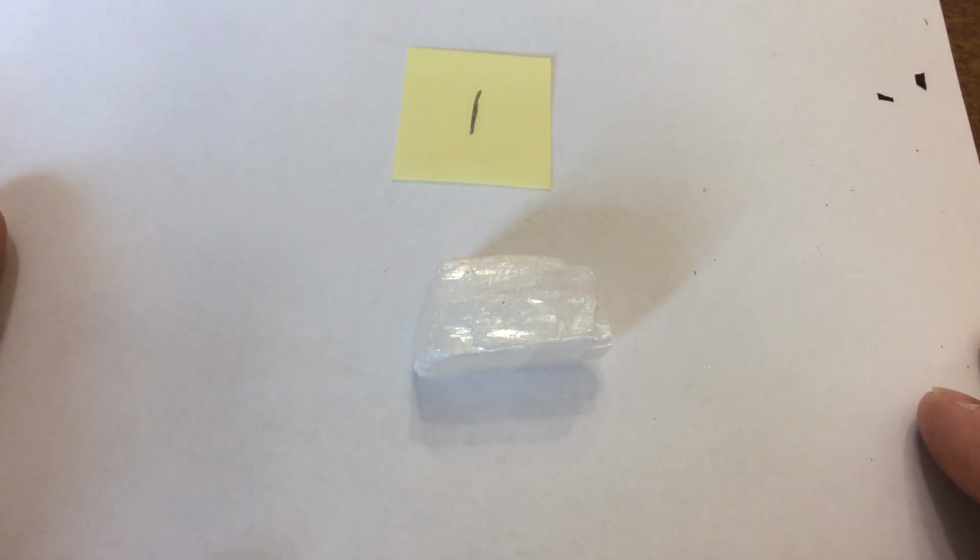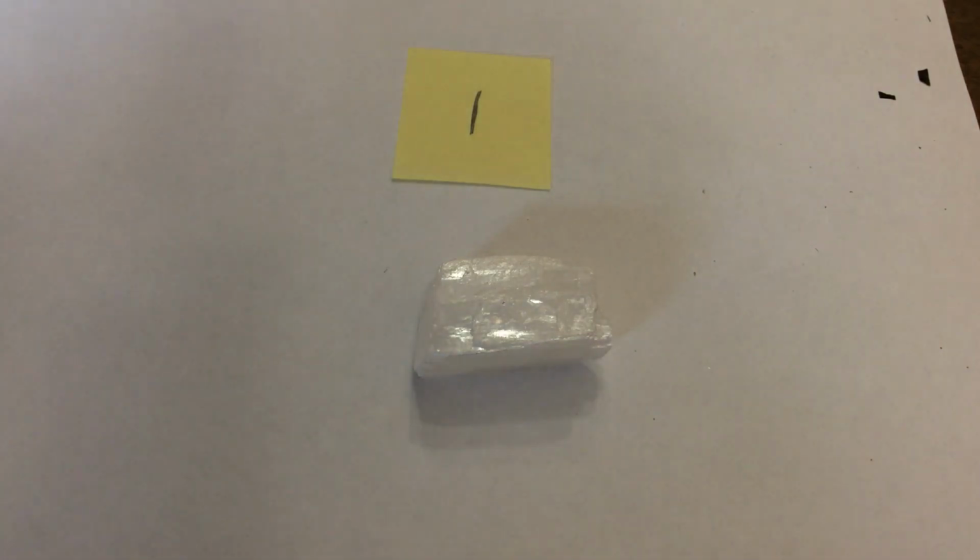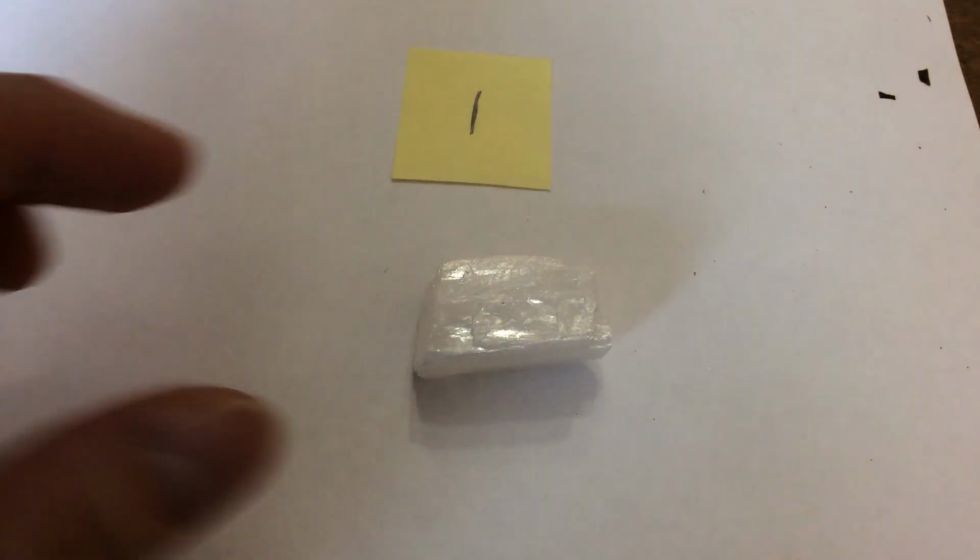I'm going to skip the hardness test so that the video doesn't get too long. But if you have it narrowed down between 2 items and you just need to know something about the hardness, you can email me and I will give you a clue.